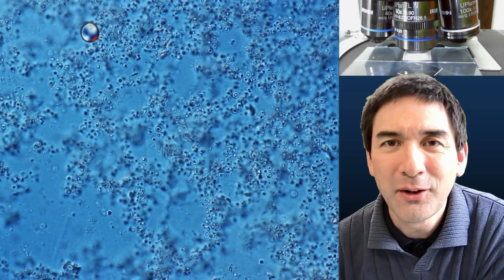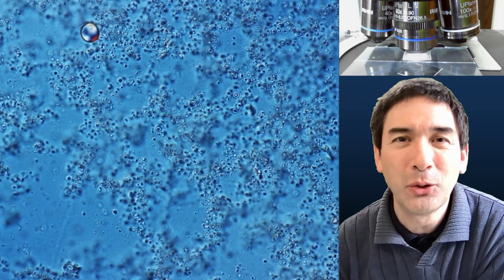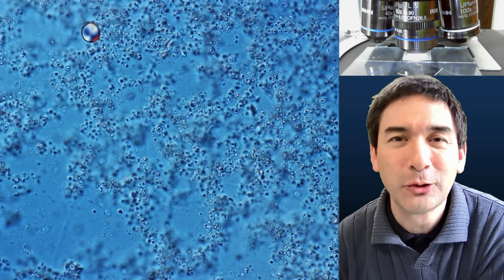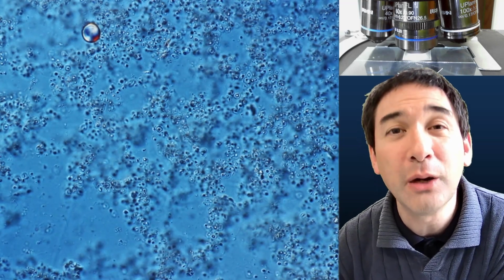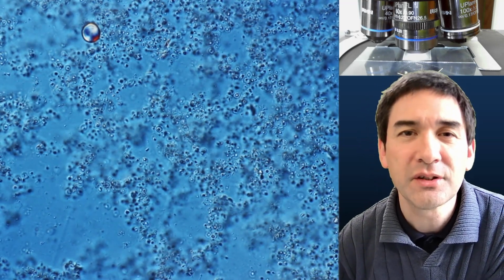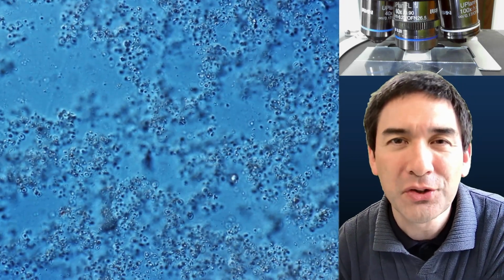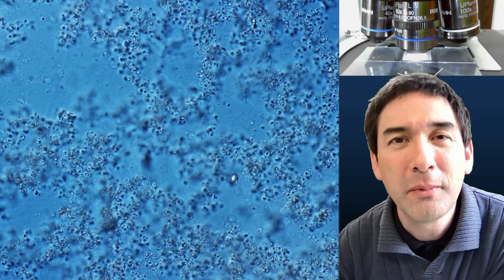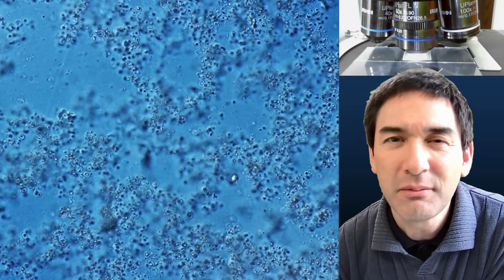So, this is how the year-old sample looks under the microscope. We do see a lot of tiny little dots. Some of them are moving and vibrating because of so-called Brownian motion. Occasionally you might also be able to see a streaming of the fluid. That is because of capillary action under the cover glass. But honestly, these are not yeast cells.